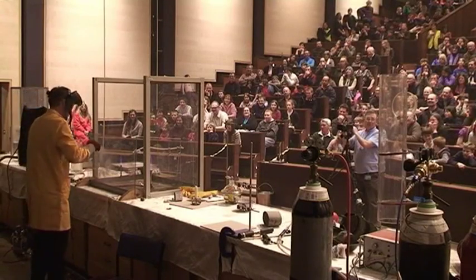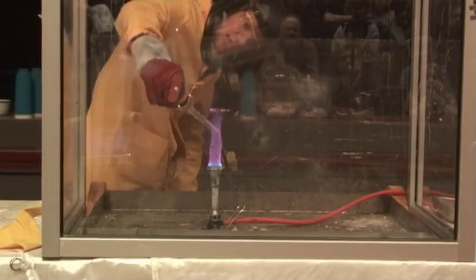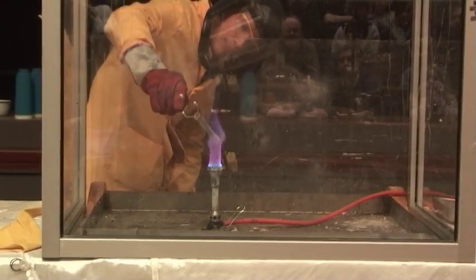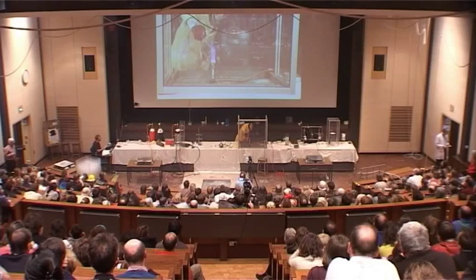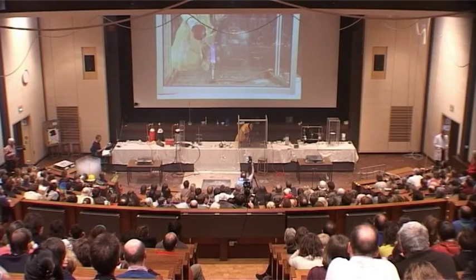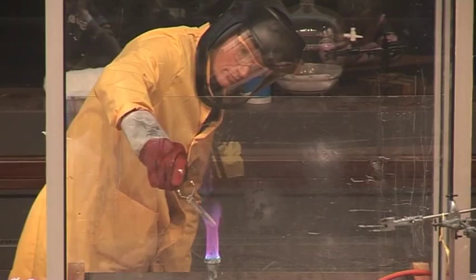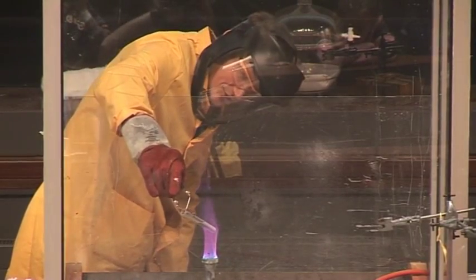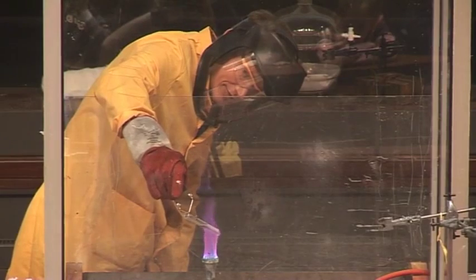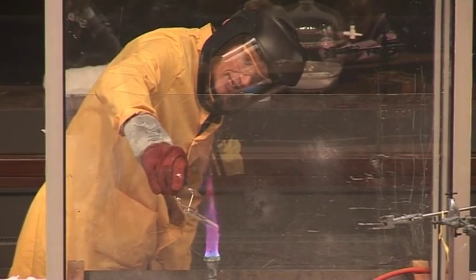What do you expect? Now this takes a little bit of time for the reaction to start, before the magnesium burns. We're trying to see if burning magnesium reacts with sand. This will take a little bit of time just to get it hot enough, but once it's hot enough we want to see if there's any reaction.